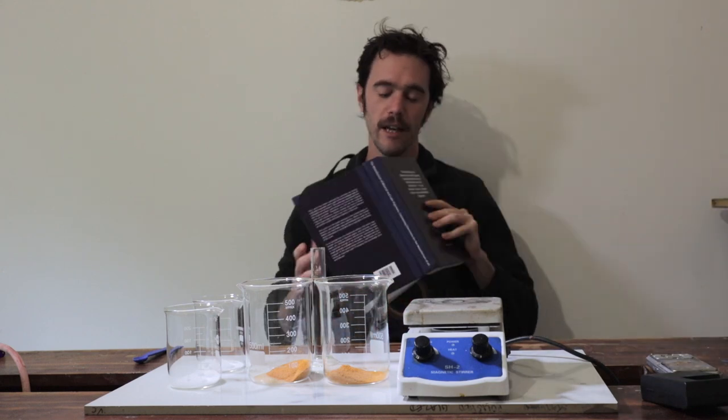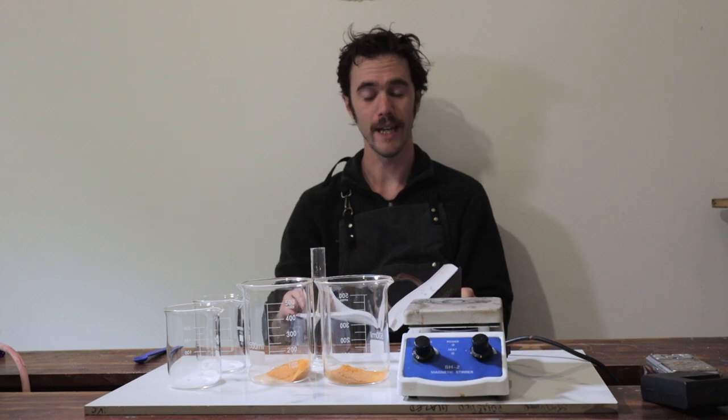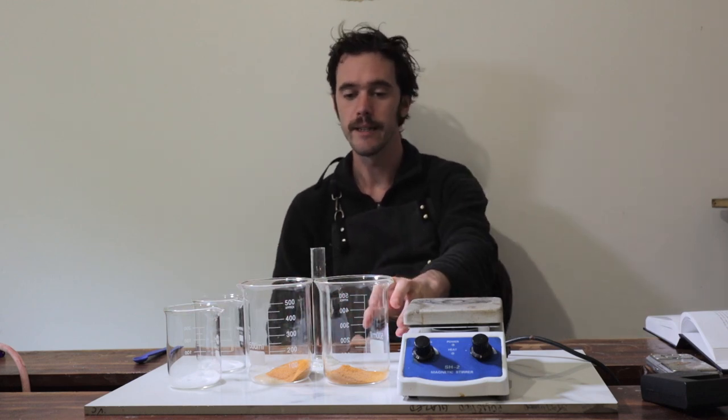In the past when I've been tinkering with Brazil wood pigments, I tend to end up with some pretty intense pinks and I'm yet to really end up with a pure red. I'm working from Joseph Birch's book here, going through some of his methods for getting the redwood lakes. From what I've read, boiling the powdered wood in hot water is actually the preferred extraction method and does better than extracting with the alum present. So the first extraction we're going to do is just boiling — I've got 10 grams of Brazil wood powder and I'm going to boil this in 300 ml of water for about an hour, then filter off the powder and collect the clean extracted liquid.